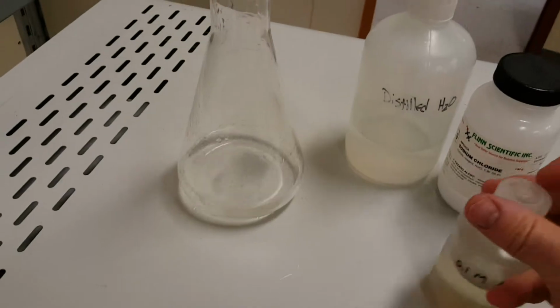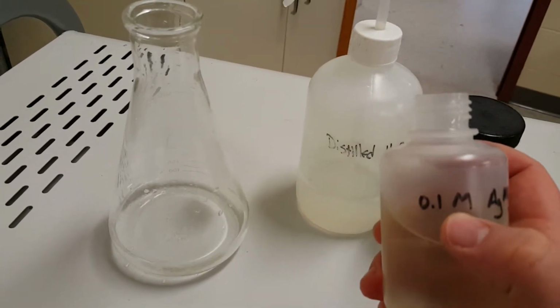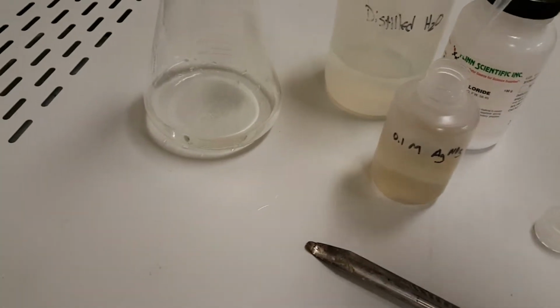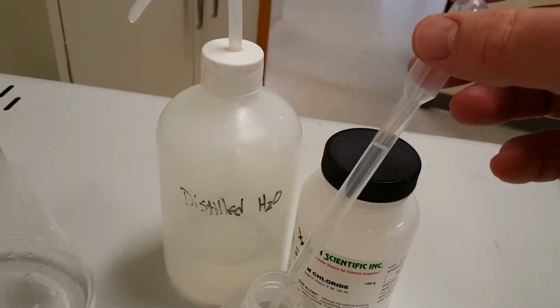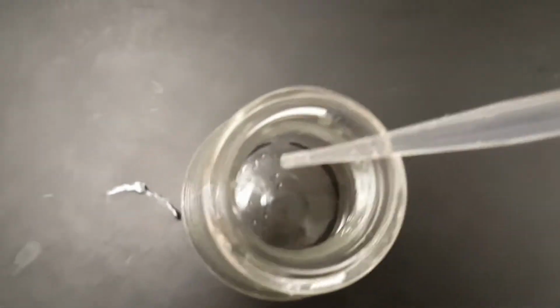What I want to do is add to my sodium chloride some silver nitrate, AgNO3. This is 0.1 molar, which as things go is kind of dilute, but concentration is a relative thing, right? So that liquid is clear as well. So I have a clear liquid, aqueous solution, clear liquid, aqueous solution. And what's going to happen when I mix these two things? I want to put it over here just so we can see for sure. Got a squirt of the stuff, and we'll see if I can do this properly.